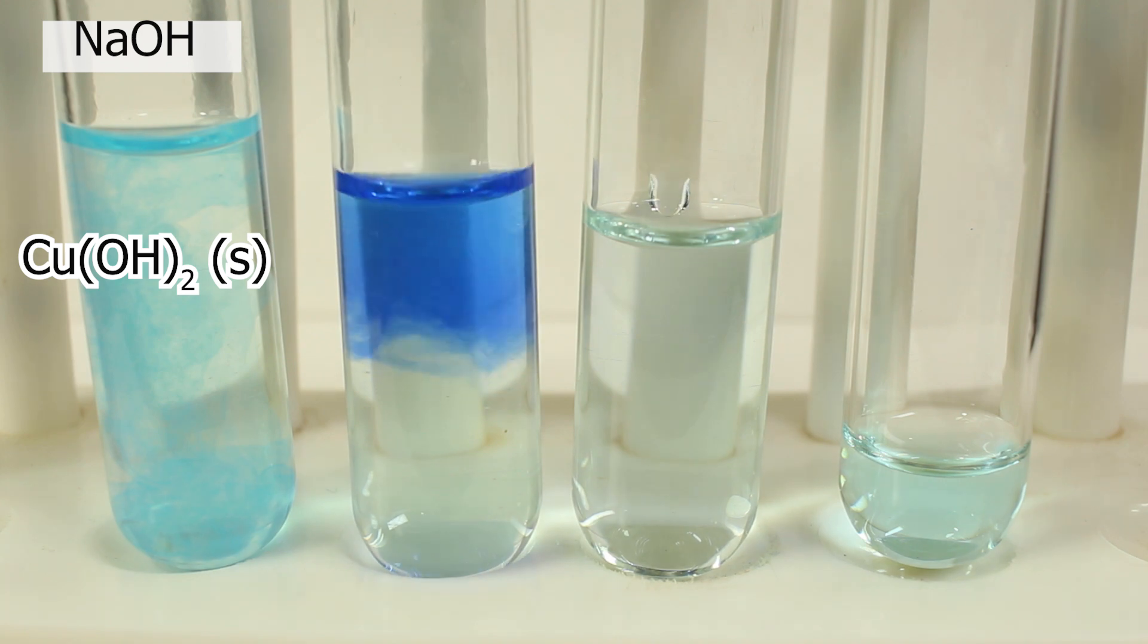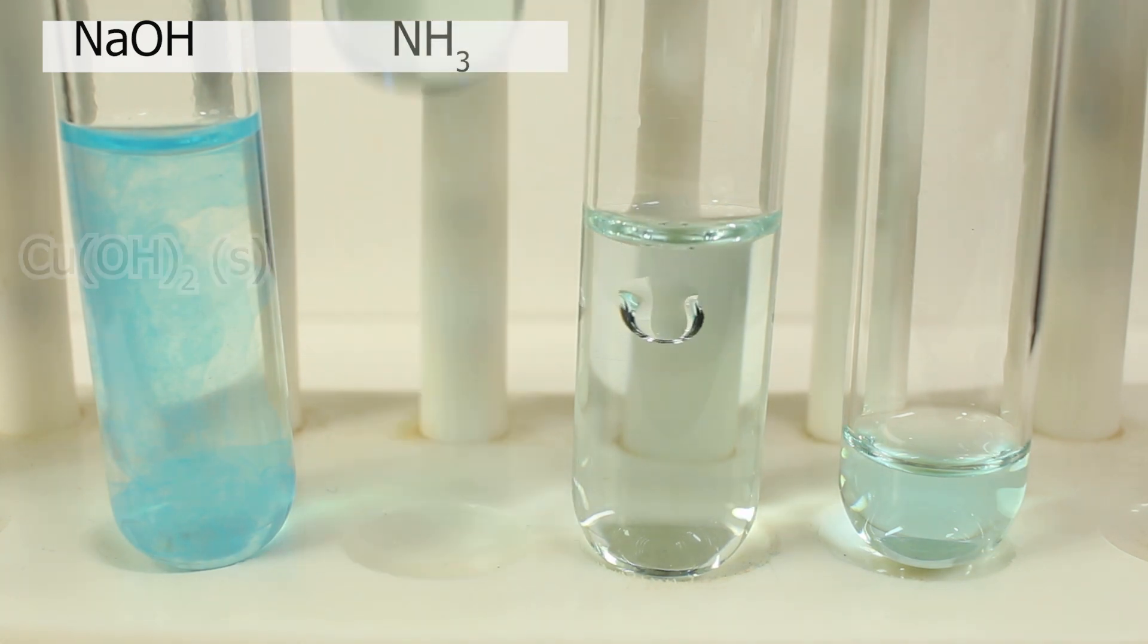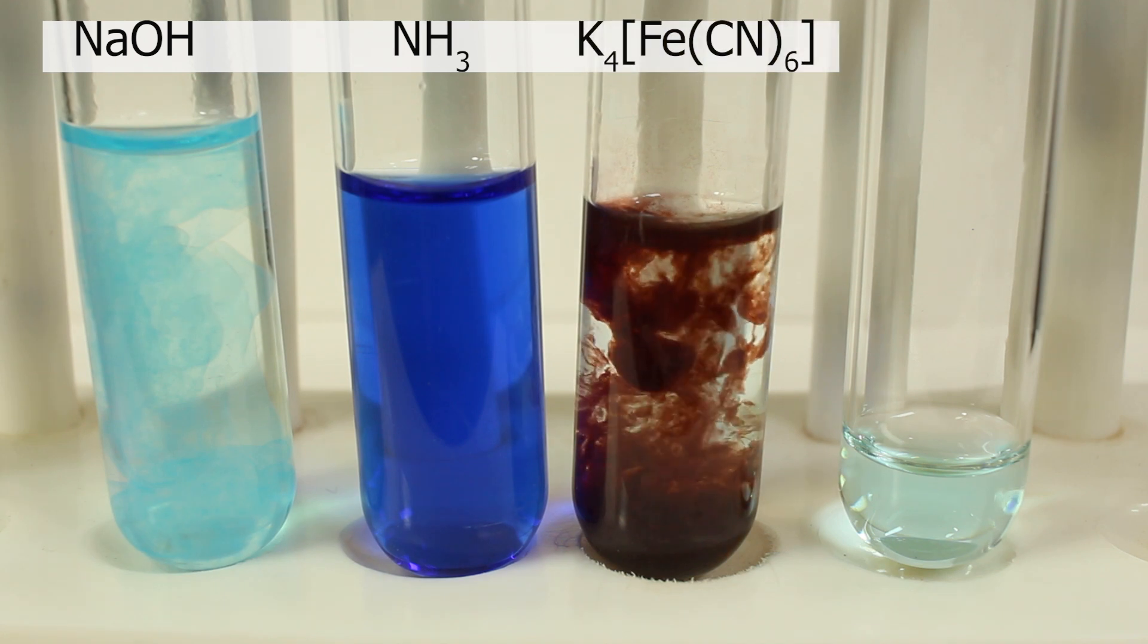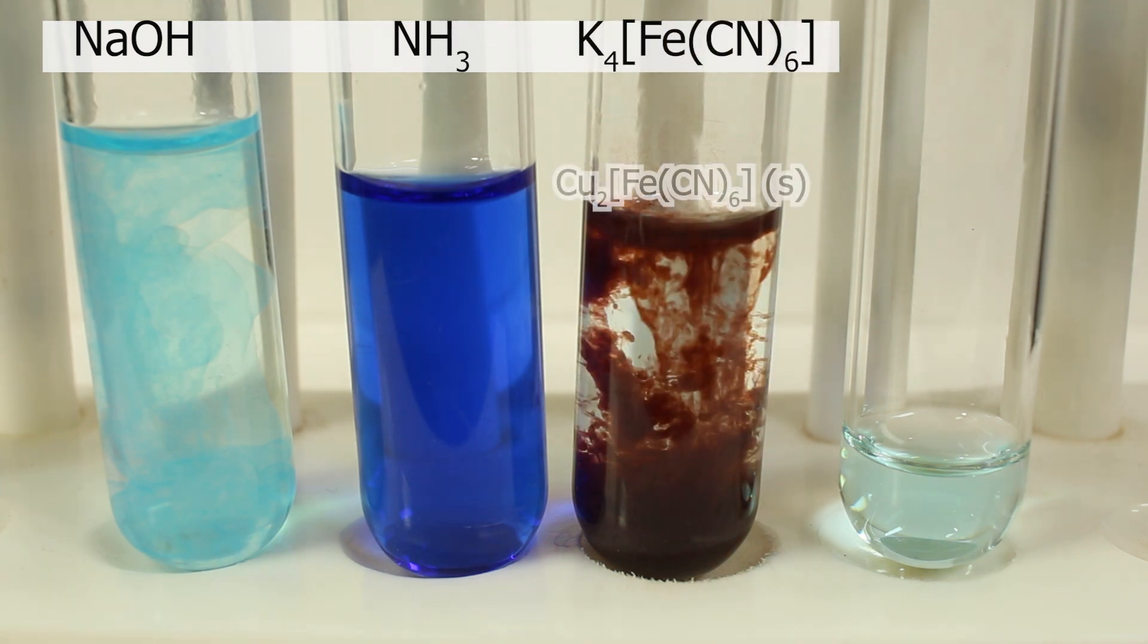Ammonia, deep blue solution of tetraammine diaqua copper II. Potassium ferrocyanide, chocolate brown precipitate of copper II ferrocyanide.